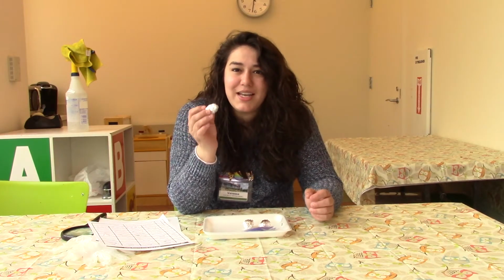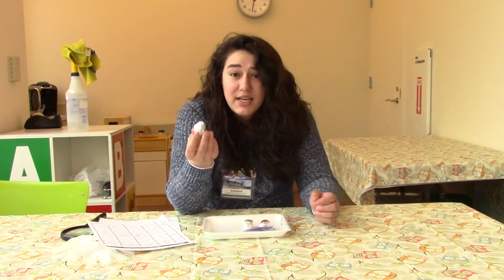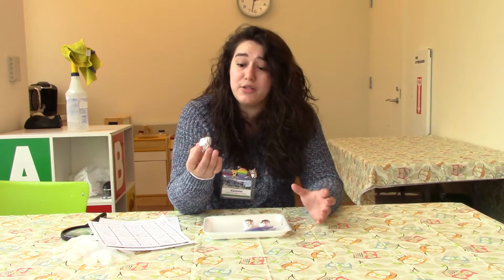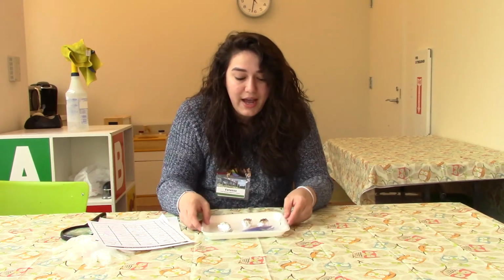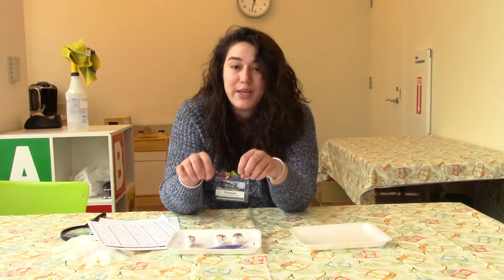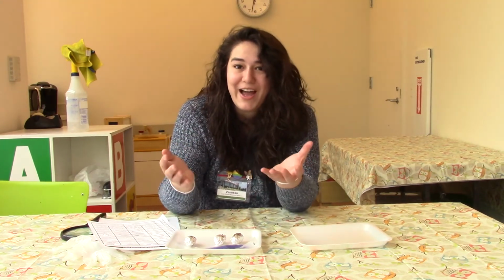And so I'm really excited to see what we have inside of each one of our owl pellets. And scientists actually use these to be able to see what kind of animals are in the area and what kind of animals owls are preying upon. And so today we're going to get to see what's inside of our owl pellets. I have a couple of trays here, and a couple of different owl pellets so we can sort through and see what we can find. And I'm really excited, so let's get started.